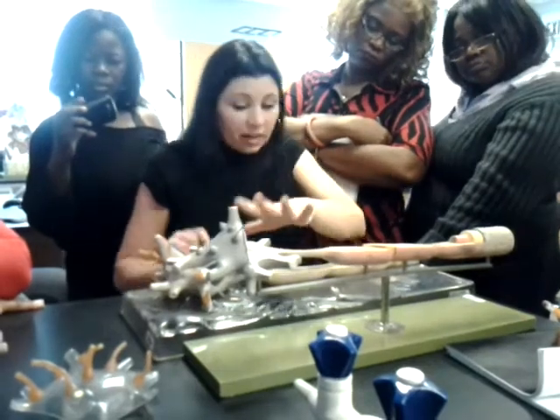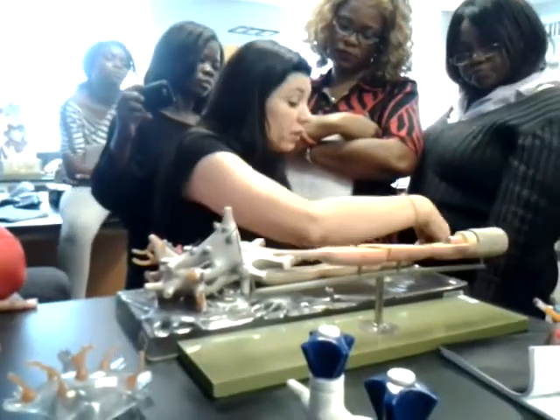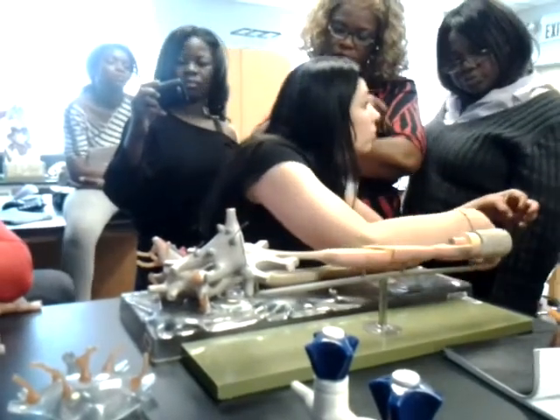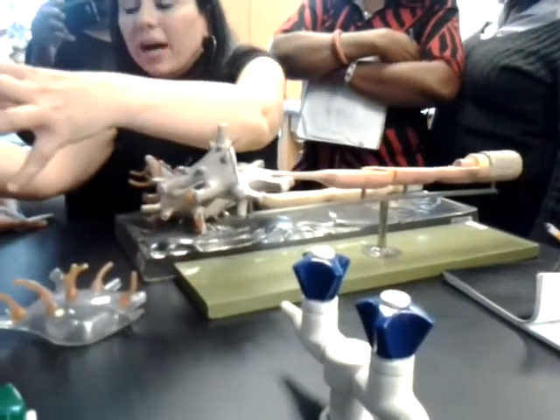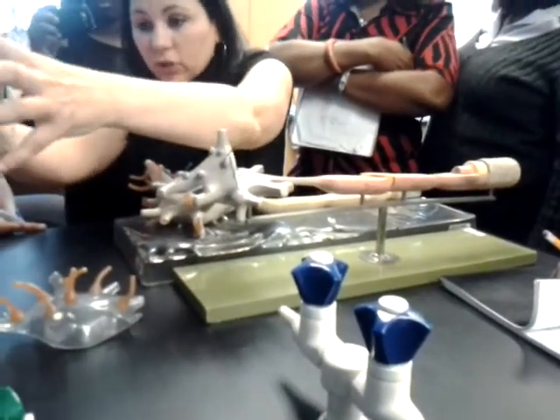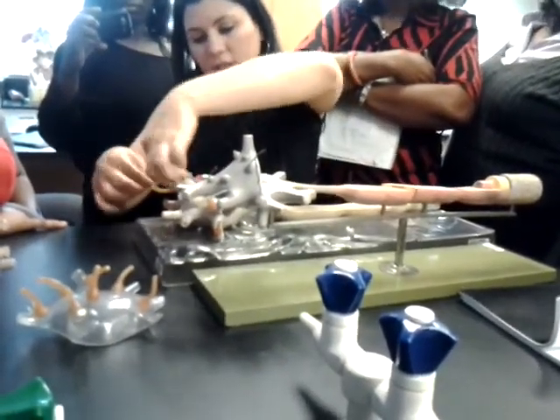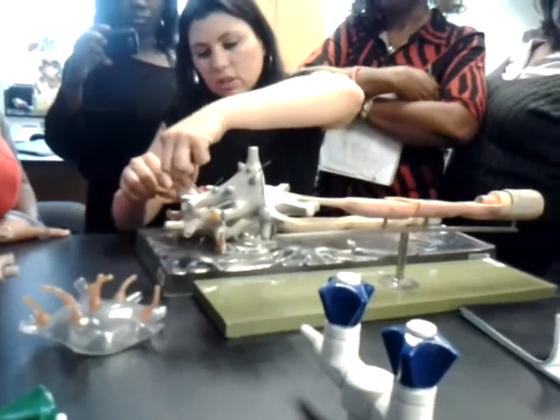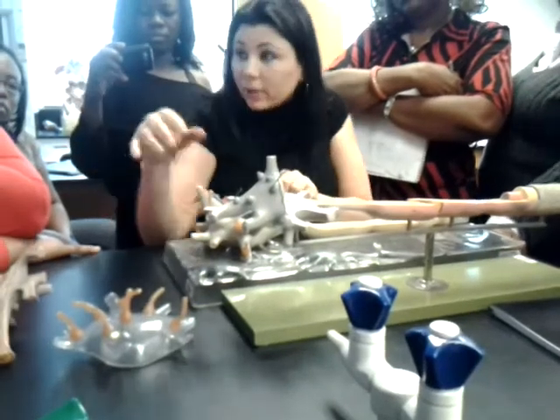Now, we've got this. Remember that they cut this off. In real life, this would have continued until it reached its end, and it would branch out into telodendria and have its own synaptic knobs. Okay, we can't see that here. Instead, we have a dendrite and cell body of a different neuron, which sends its axon, and all of these thinner branches are the telodendria of that different neuron that we can't see.